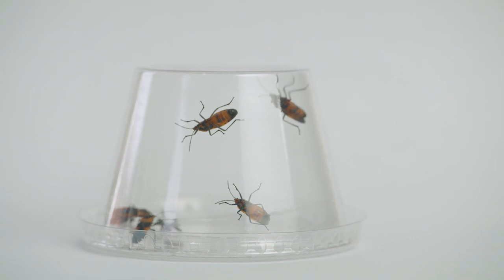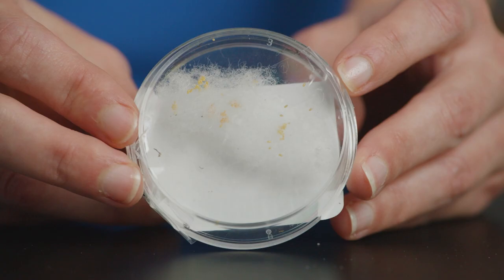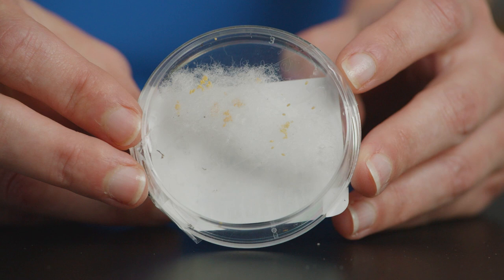Milkweed bugs provide an excellent opportunity for students to observe a life cycle that includes incomplete metamorphosis. When you receive your order, open the container and inspect your milkweed bug eggs.